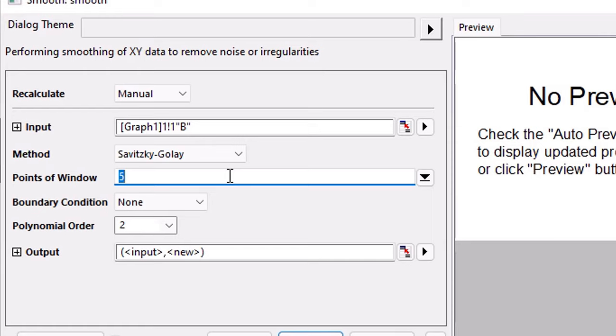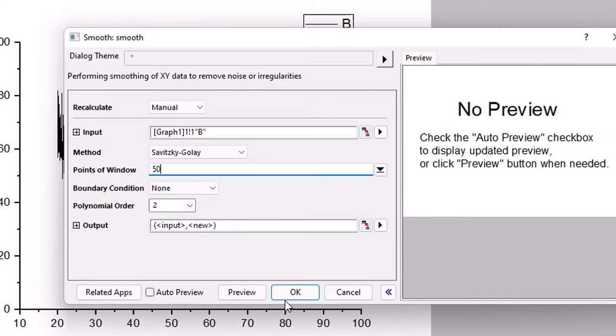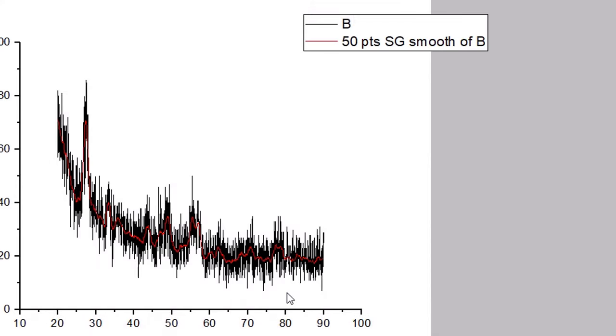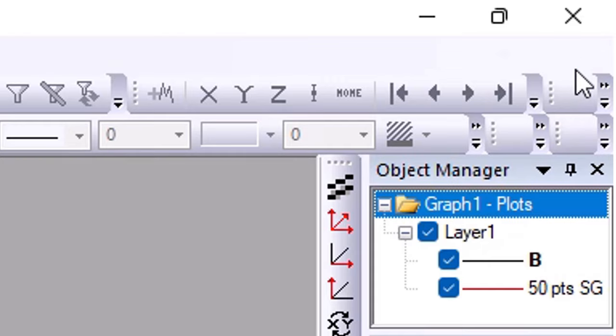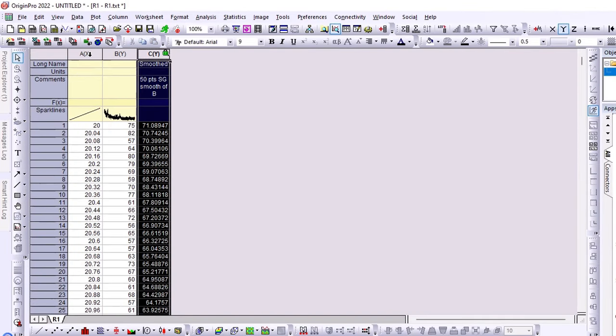How many points can you smooth? 5 points, 10 points, 20, 50. I select the value 50. And now my data is smooth. I have smooth data. Now I create a graph.